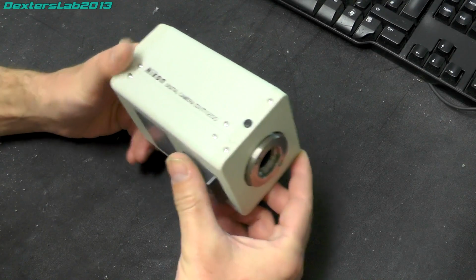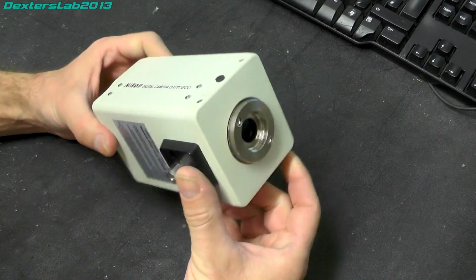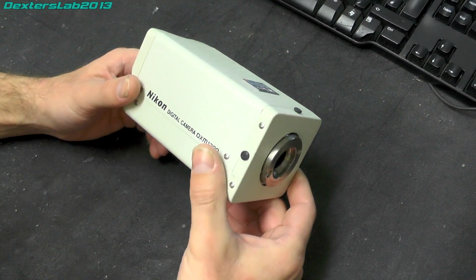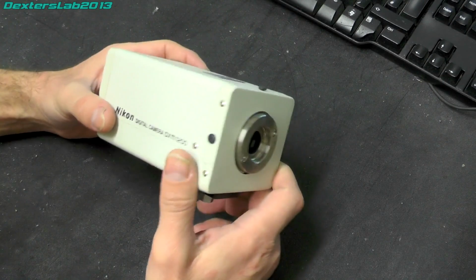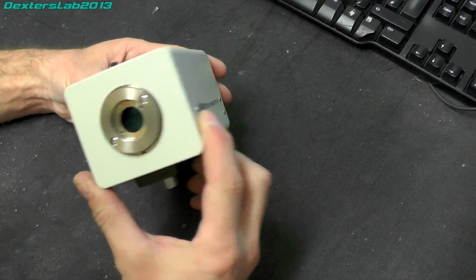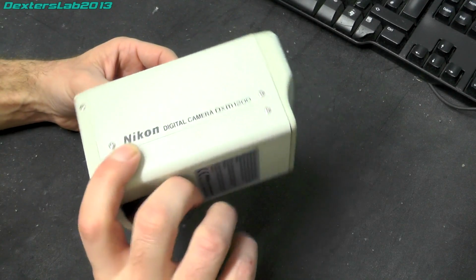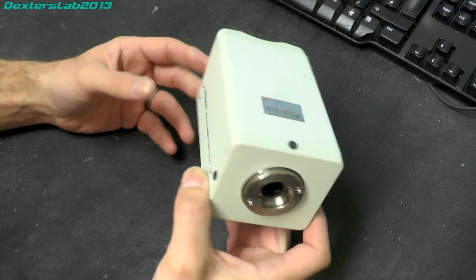Now the specifications on this are, it's 12 megapixel, which considering this dates from 2000, that's actually quite a high number, but it's not quite as cut and dried as that. I'll get into that in a moment. I think the cost of this camera was probably about $7,000 in 2000, so yeah, not a cheap camera at all. But of course that would have included the interface card and all the software that ran it.